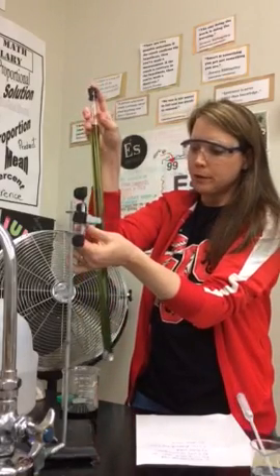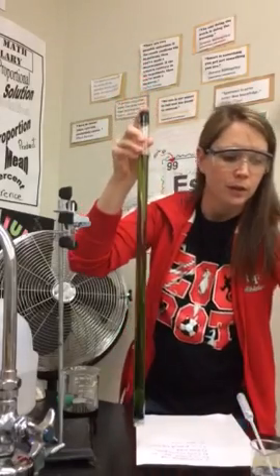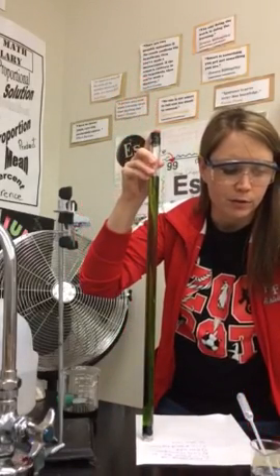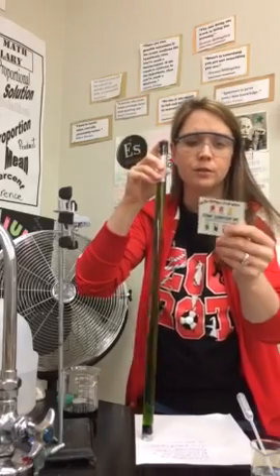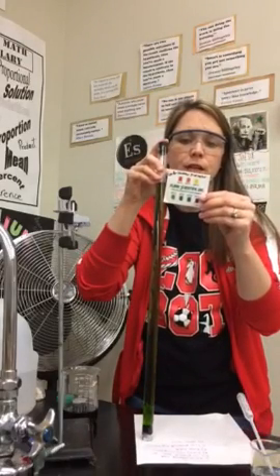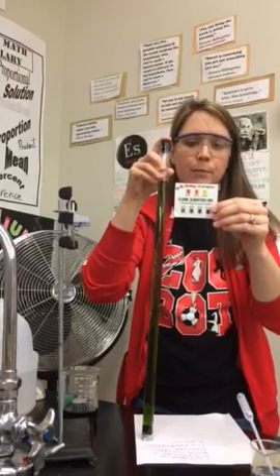In the tube is universal indicator and deionized water. At this time, can you pause the video and make sure each of the students have the universal indicator cards, and then make a few observations about the information on the page.